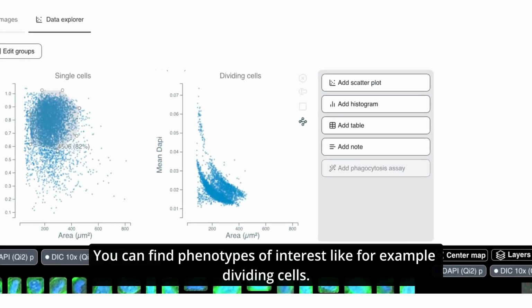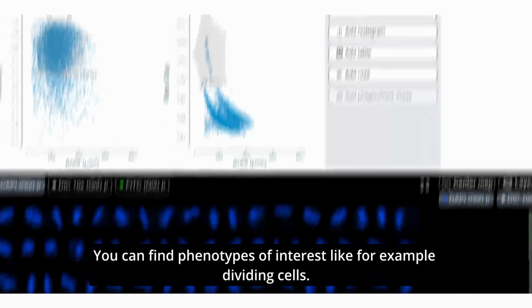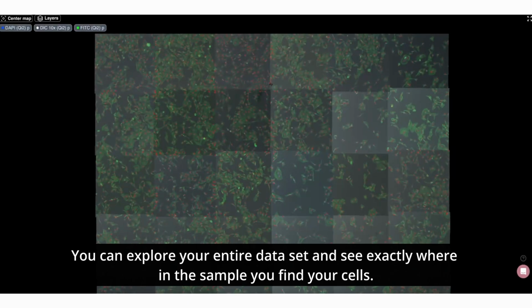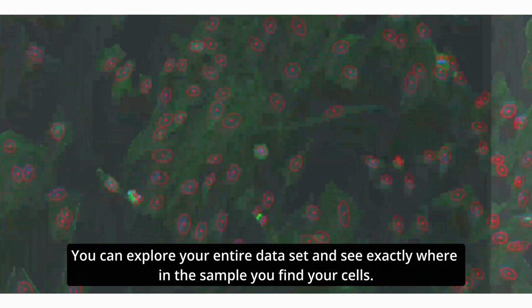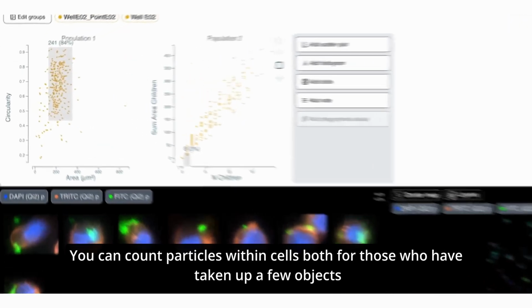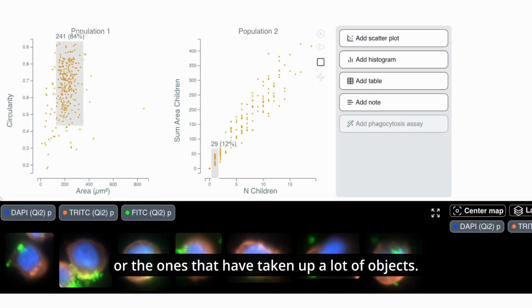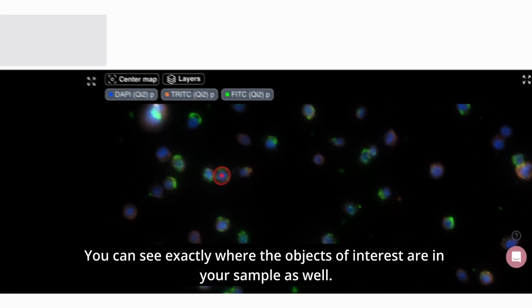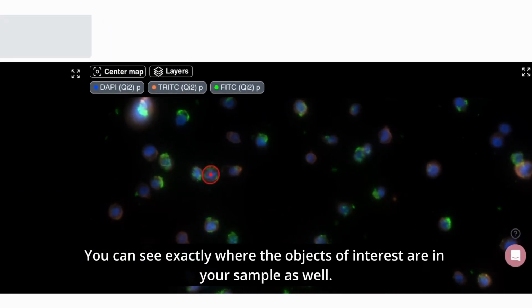You can find phenotypes of interest, like for example, dividing cells. You can explore your entire dataset and see exactly where in the sample you find your cells. You can count particles within cells, both for those who have taken up a few objects or the ones that have taken up a lot of objects. You can see exactly where the objects of interest are in your sample as well.